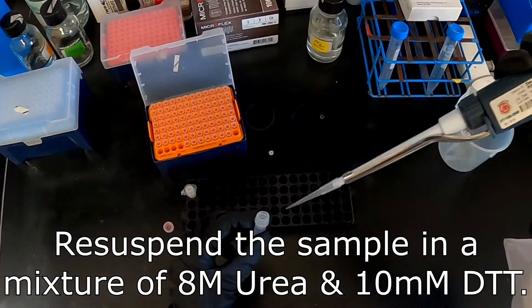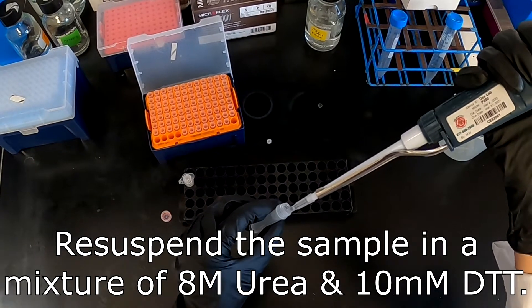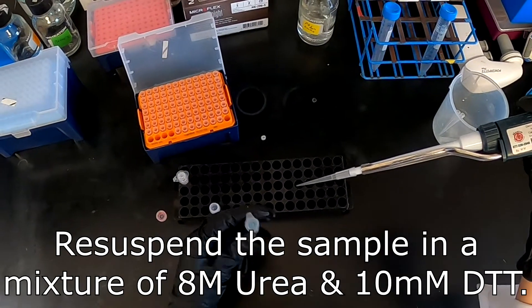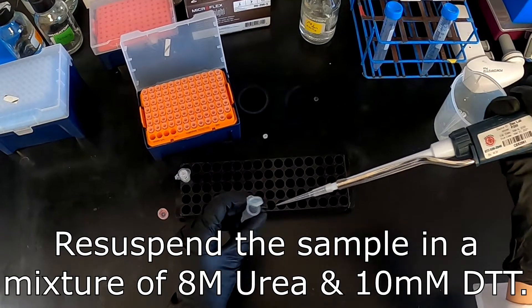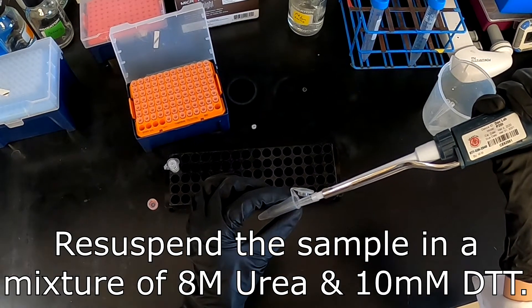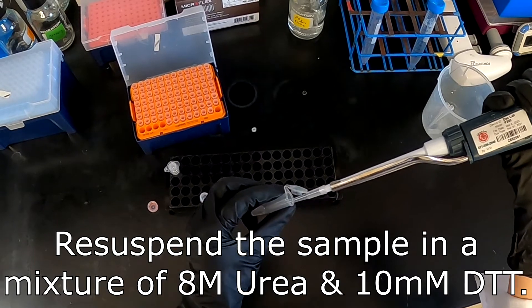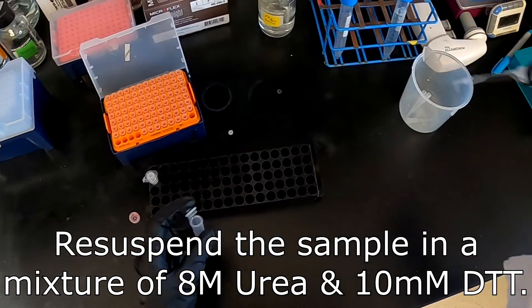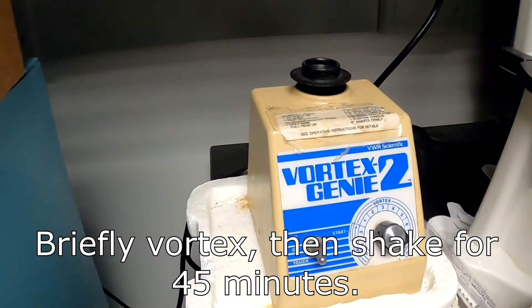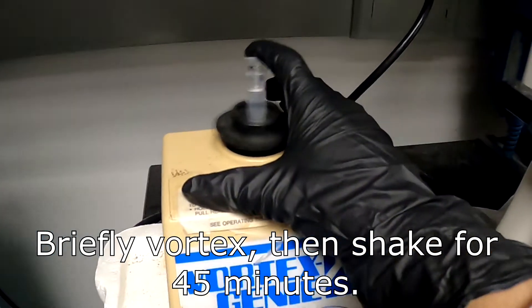In order to carry out the FASP protocol, the first step is to add a mixture of 8 molar urea and 10 millimolar DTT into 50 micrograms of your protein sample. A final volume of up to 200 microliters is important to adhere to, because the FASP cannot accommodate more volume. The sample was then briefly vortexed and rocked at room temperature for 45 minutes.